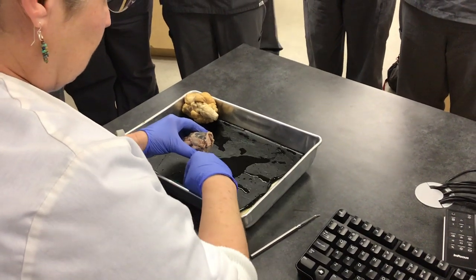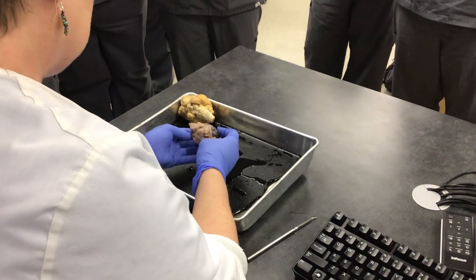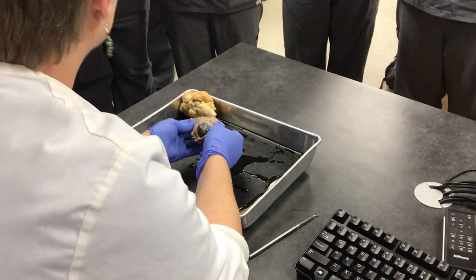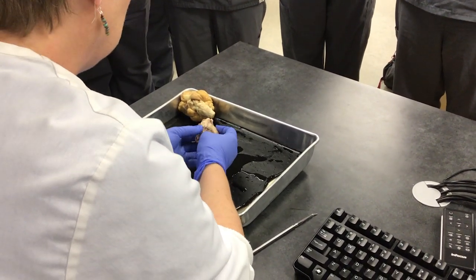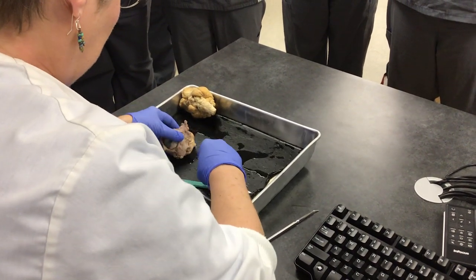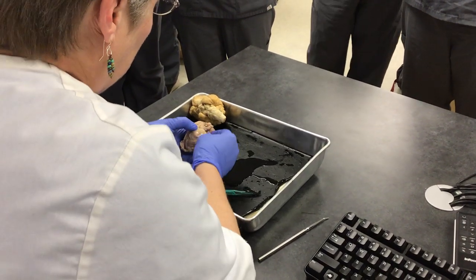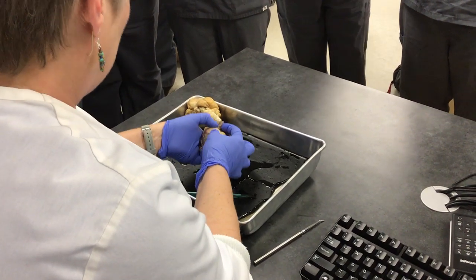Very similar to ours, except it's much bigger, right? So it has lots of muscle around it, just like our eyes do, lots of fat. So when you're cutting around the fat and you're cutting through that muscle, watch for this little guy right here.